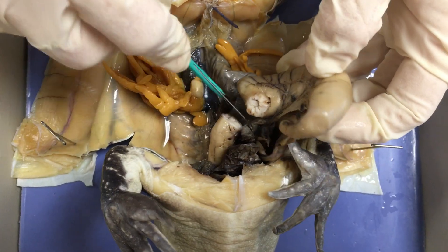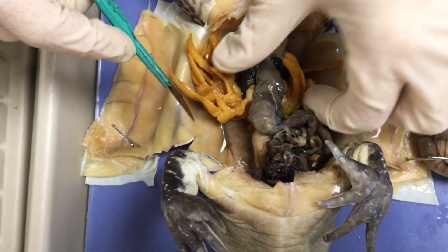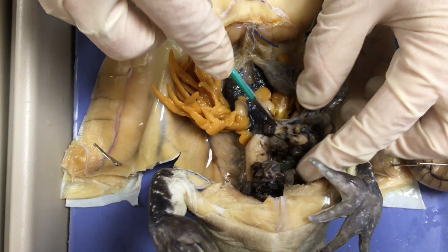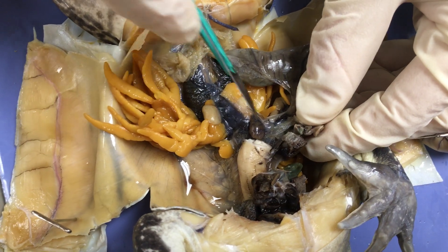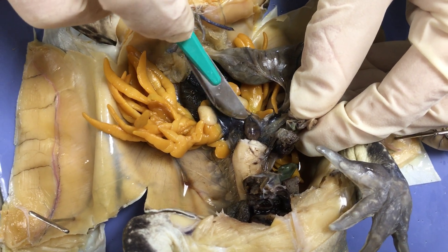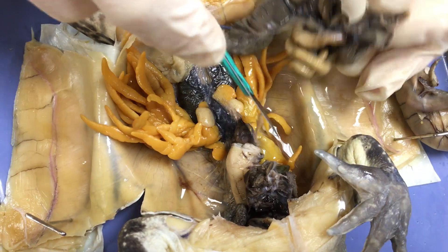If you were here in class, I would encourage you to cut open their stomach to see if we could find anything fun in there — sometimes there are little pieces of insects or crawfish. This kidney bean-shaped structure, once I've moved the large intestine out of the way, is the spleen. The function of the spleen is to help recycle red blood cells as well as destroy bacteria and other foreign invaders that get into the blood system.